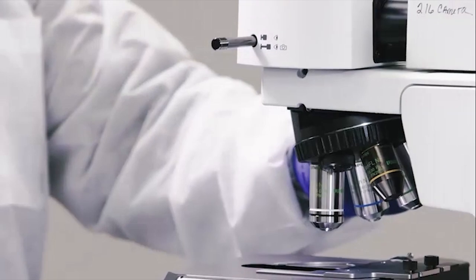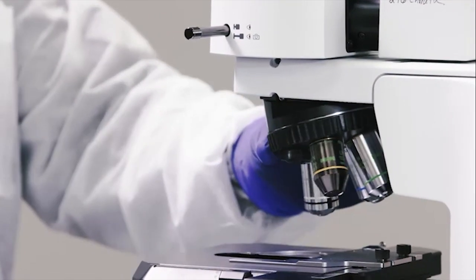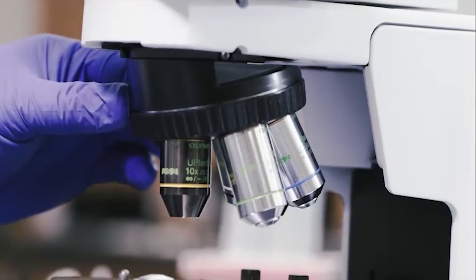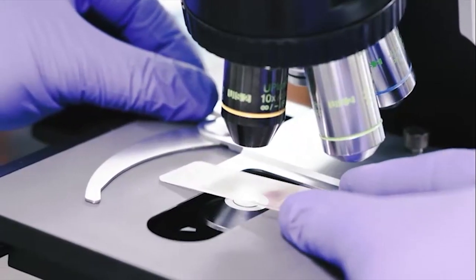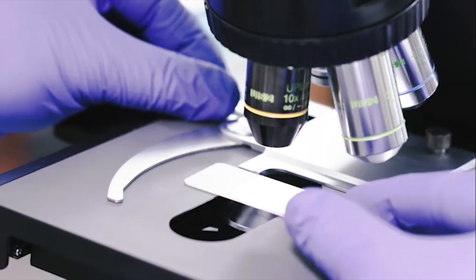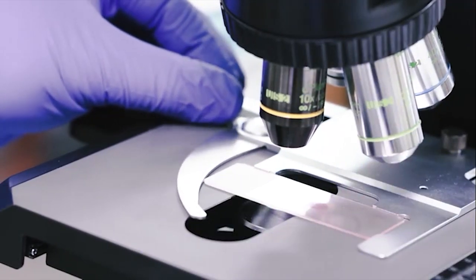The first thing that needs to occur is the 10x objective is moved into place above the stage. A slide containing a specimen is placed on the stage, centered under the 10x objective.